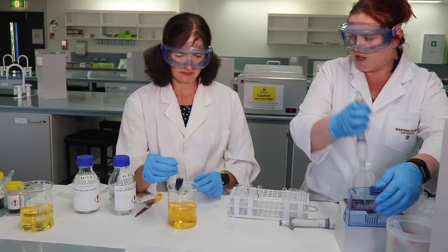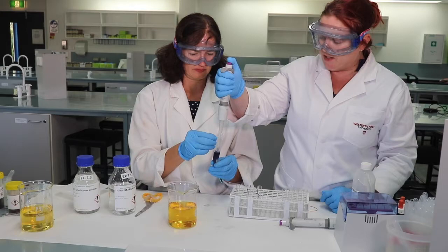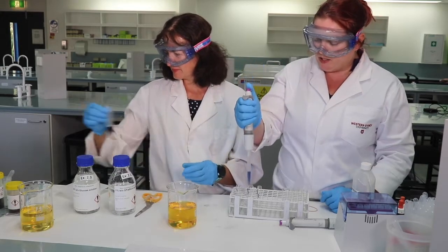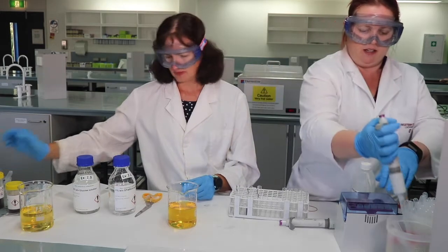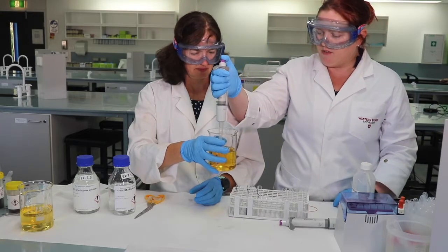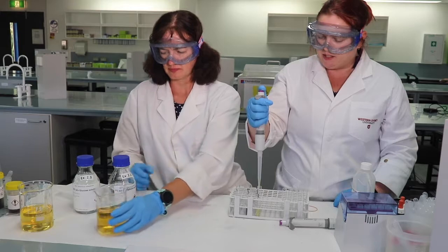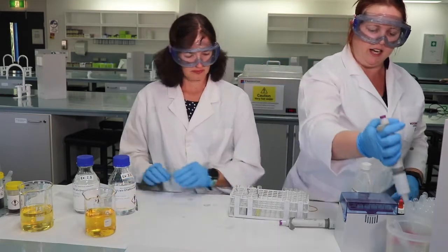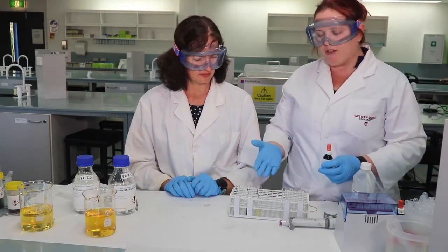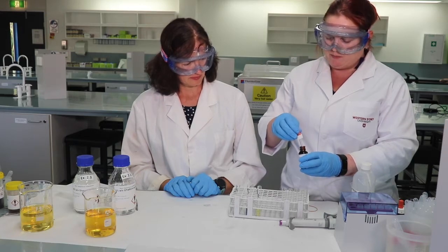Now you see Susan opened the dialysis tubing just with scissors. We can grab 2 mils out from there, into our bag solution. And then another fresh pipette, and we'll grab 2 mils of our beaker solution. So you want to be thinking about the size of glucose and iodine and starch and trying to make some predictions as to whether or not glucose might have diffused across that dialysis tubing.